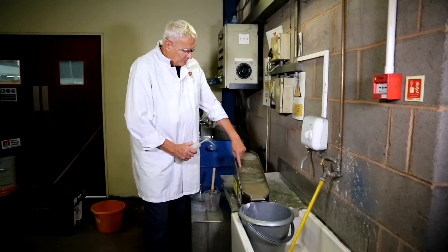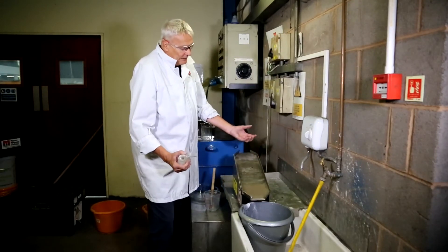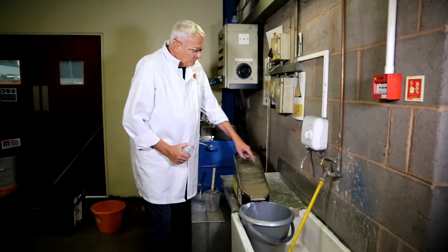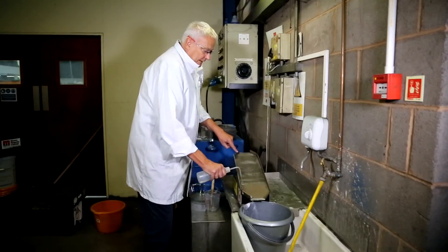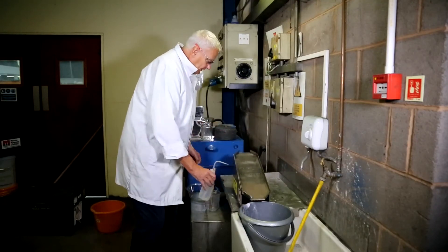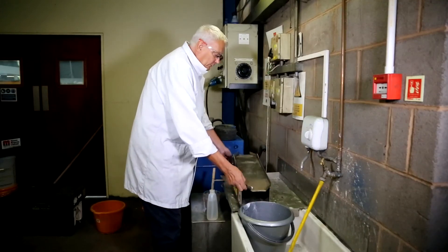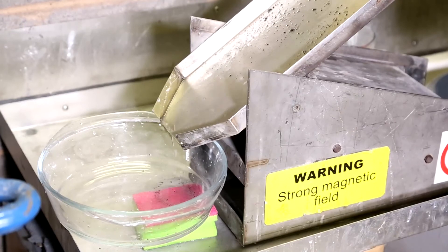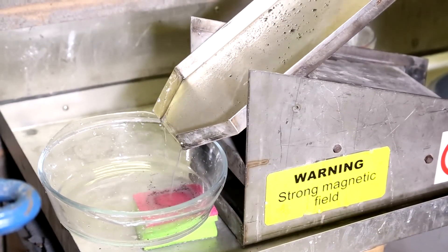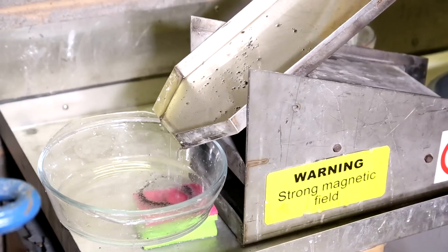You can see rows of magnetic particles here — this is my magnetite. It could just as easily be worn media from a ball mill or ferro-silicon from a scrap processing plant. To recover our magnetic material and analyze it by XRF, we simply lift up the chute and wash it down. And we have a simple magnetic separation that can be done very quickly and will mimic an industrial scale unit.